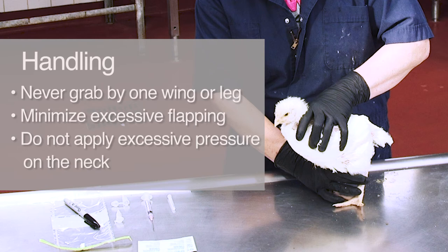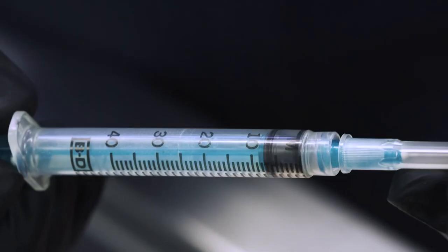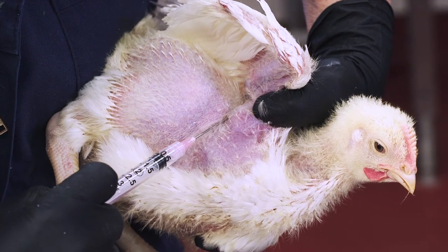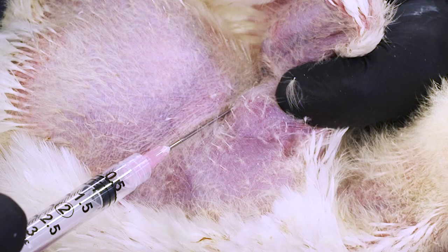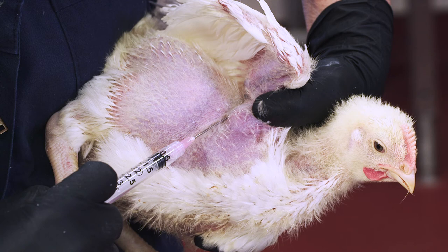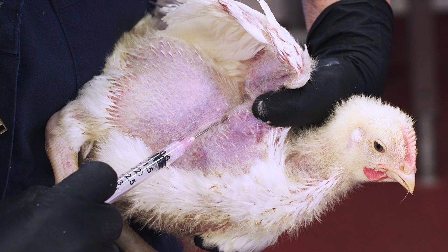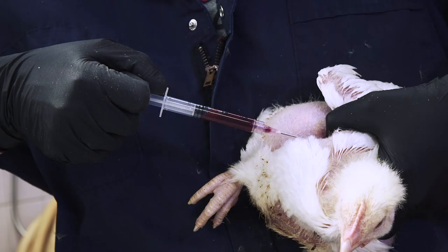Don't apply excessive pressure on the neck or keel, as this can be very stressful for the animal. To take the sample, first withdraw the plunger slightly to break the seal, creating a small vacuum inside the syringe. Hold the needle along the brachial vein, pointing towards the top of the wing. The angle of the needle should be almost parallel to the skin. Since avian veins tend to have very little connective tissue support, they can slip around easily beneath the skin. Plan to insert the needle either directly over the vein or slightly to the side, with the bevel of the needle facing up. Try not to insert the needle right on top of a feather follicle, as they are very sensitive. Insert the needle slowly into the vein. Because of the slight vacuum previously created, a small amount of blood should enter the syringe on its own. When done, withdraw the needle while simultaneously applying pressure to the puncture site.